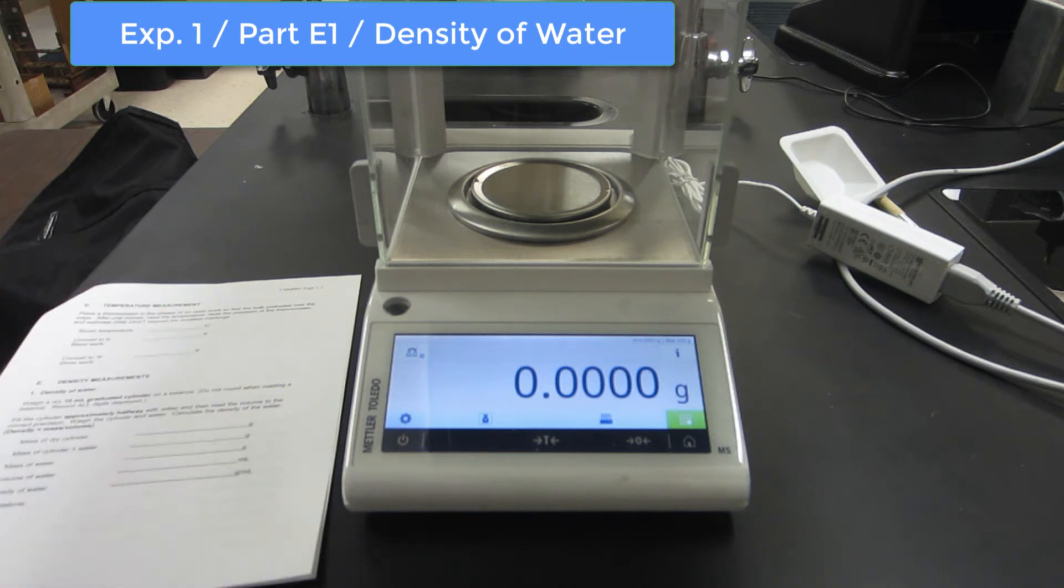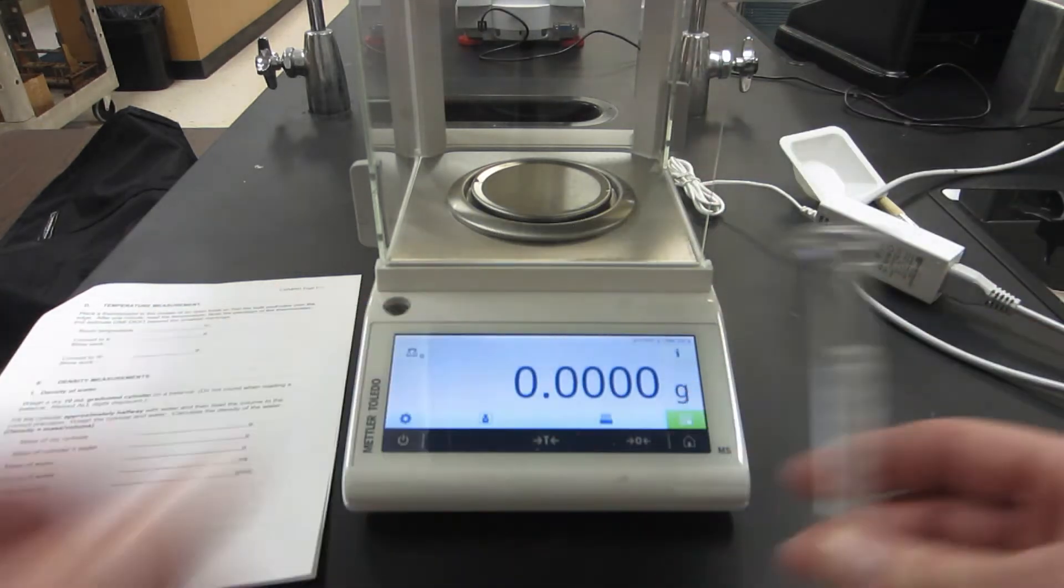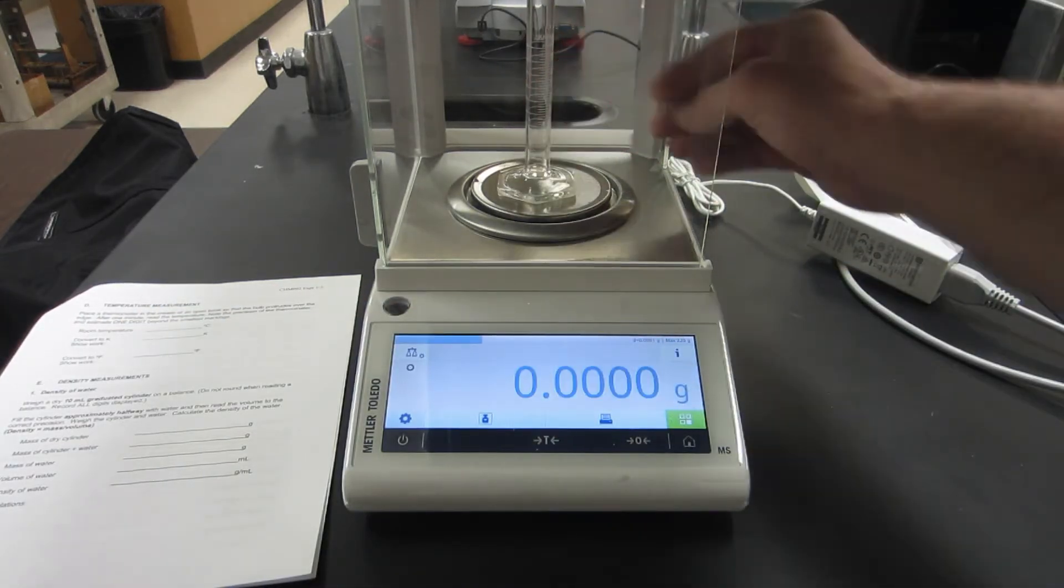Here's a short video for measuring the density of water. You always want to zero out the balance, so we did that. There is the empty graduated cylinder.